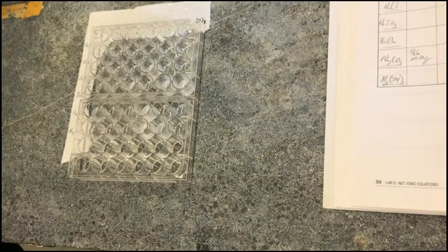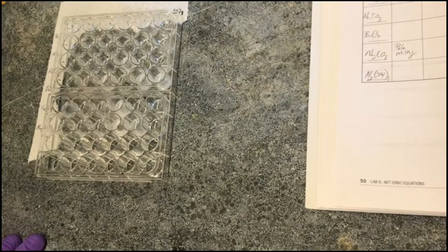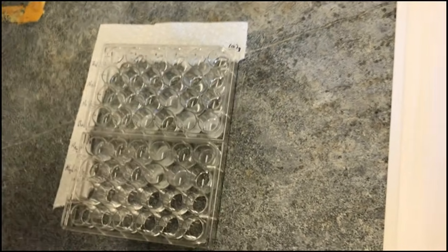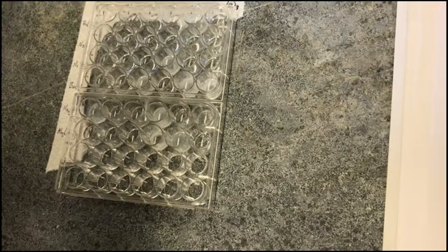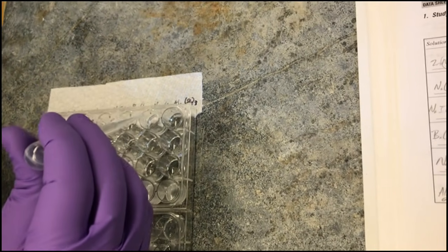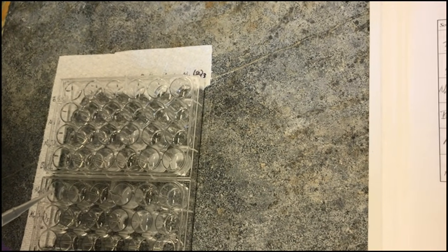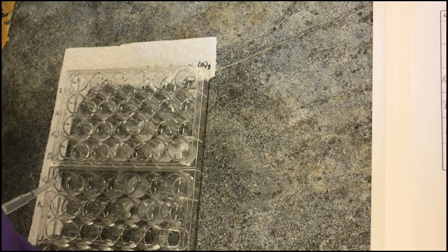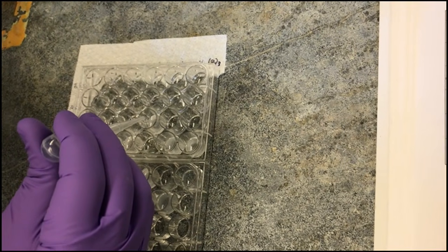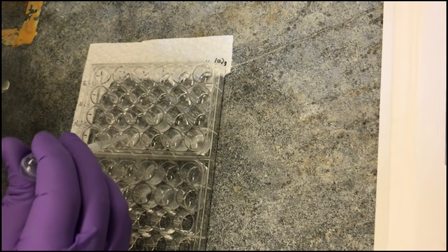So before we go to the unknowns, we have to test each insoluble compound with acetic acid. What we're going to do is add the acetic acid to each of the wells that contain a precipitate and record any observational changes. So it looks like that. That's soluble immediately. Yeah, it disappeared. You're supposed to give them a good 2 to 3 minutes to react once you've added them. So if you don't see anything right away, that doesn't mean it's not soluble.